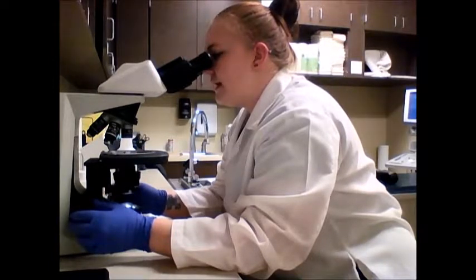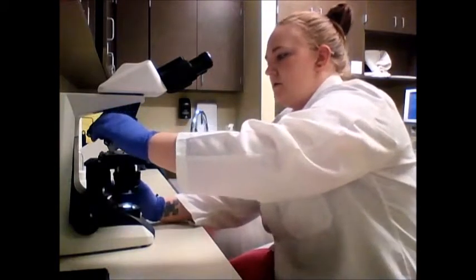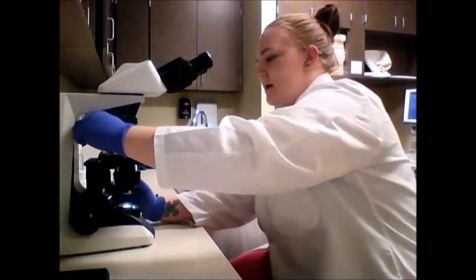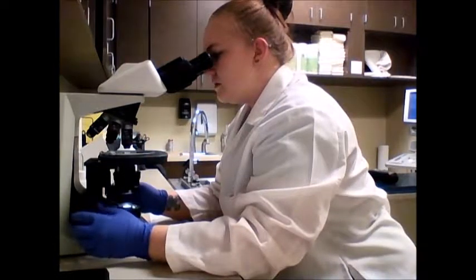So I'm going to go ahead and move to our next one, which is going to be the 10X. I'll go ahead and zoom in.